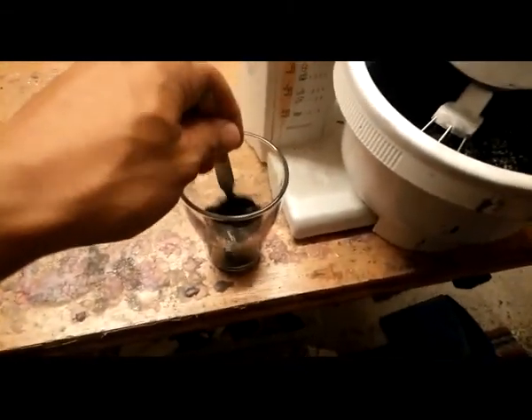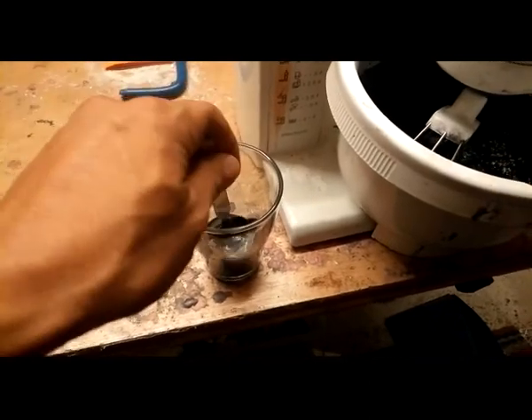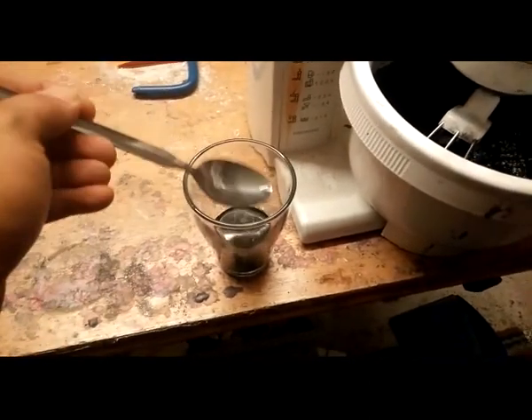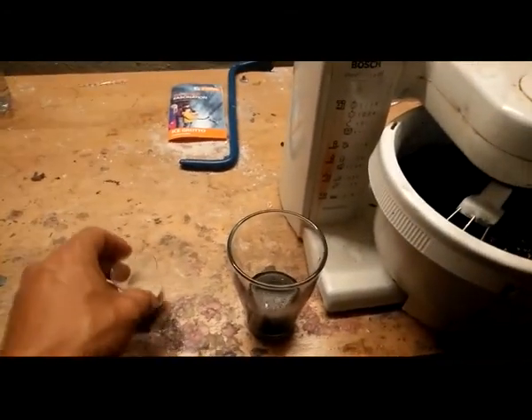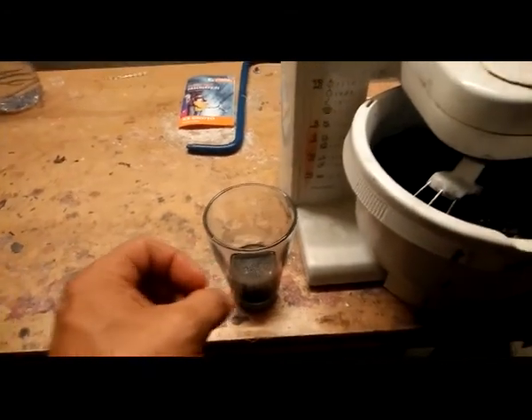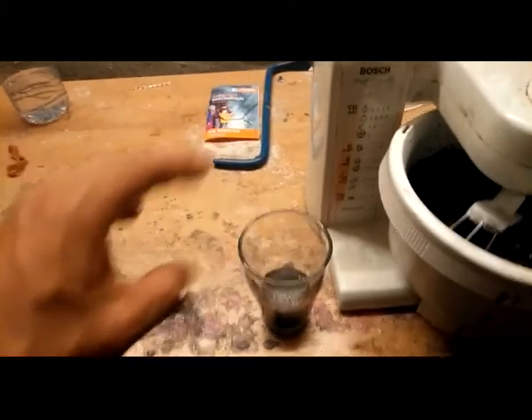I do this a little bit in water. And here I have some yeast fungus. I hope it will intercalate with the sugar and the graphite and expand it to a foam.